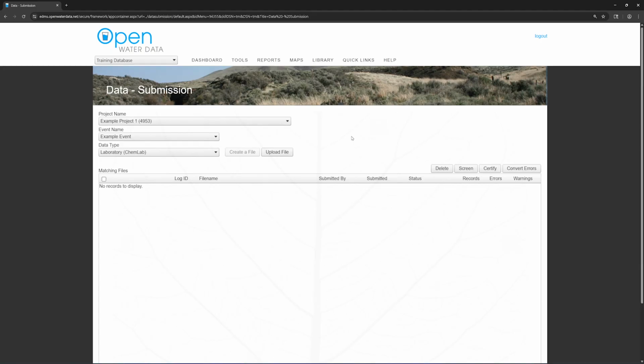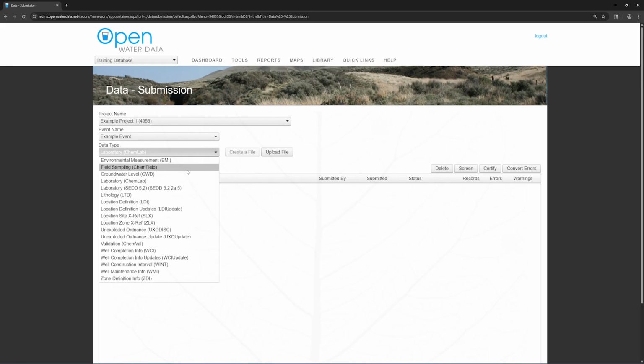If you load the data to the wrong event, delete the file. Leaving the file there and uploading a new version to the right event may result in the system thinking the new file is a duplicate and flagging errors. Once you are in the right project and event, choose the data type of Laboratory ChemLab. Choose Upload File.